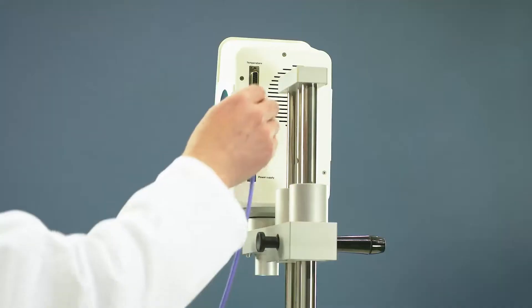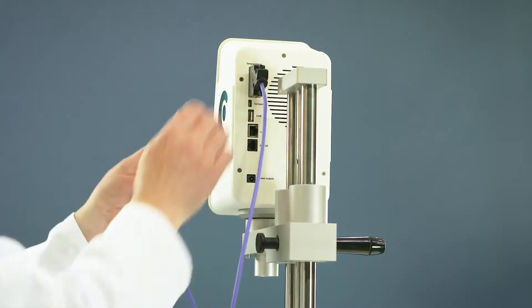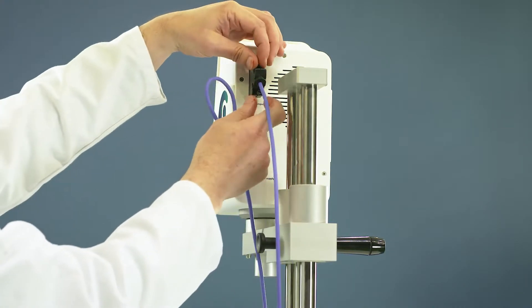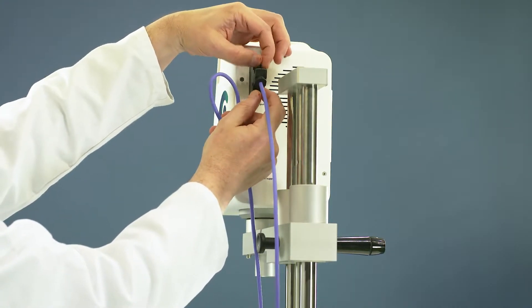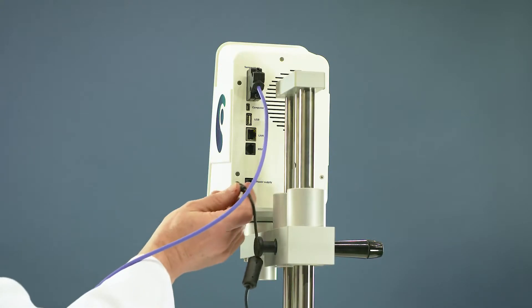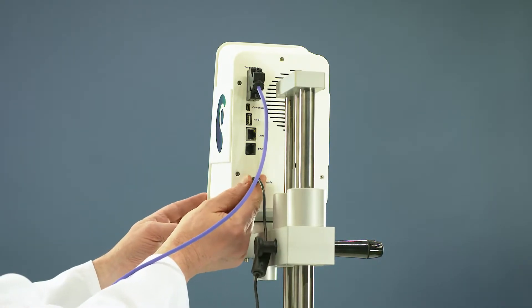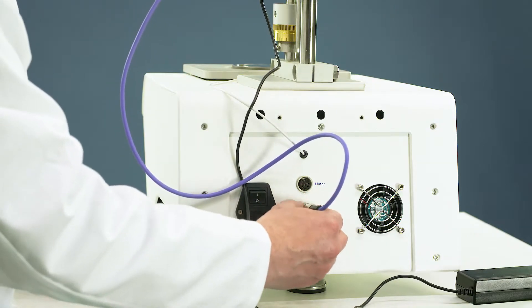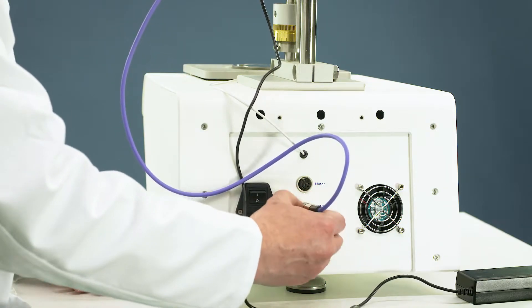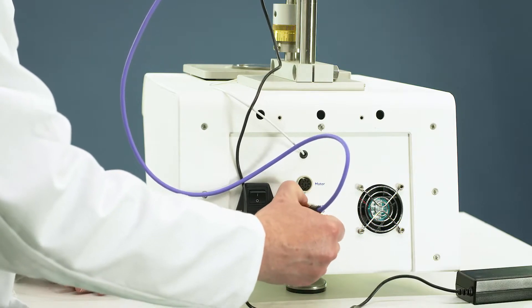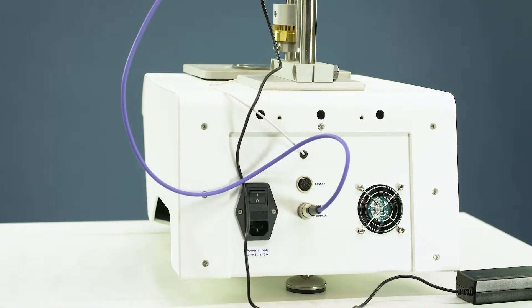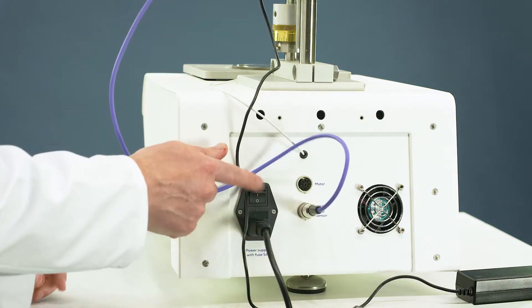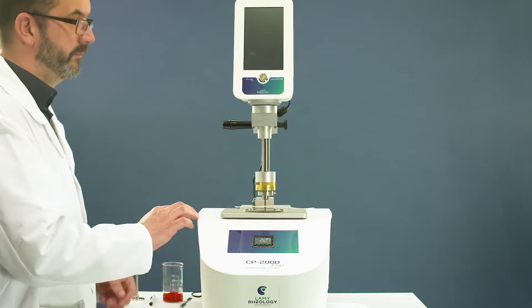Unpack your device and the connecting cable. Switch on RM100 CP2000+.